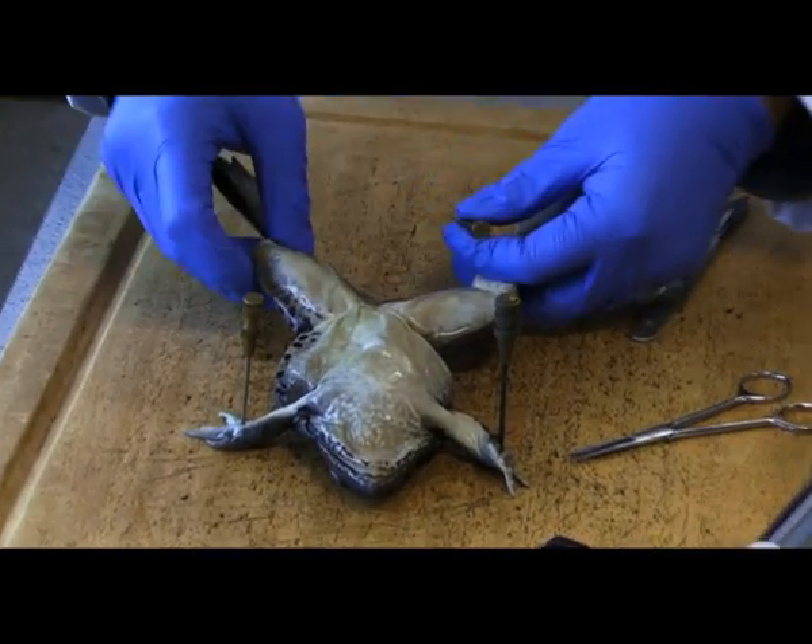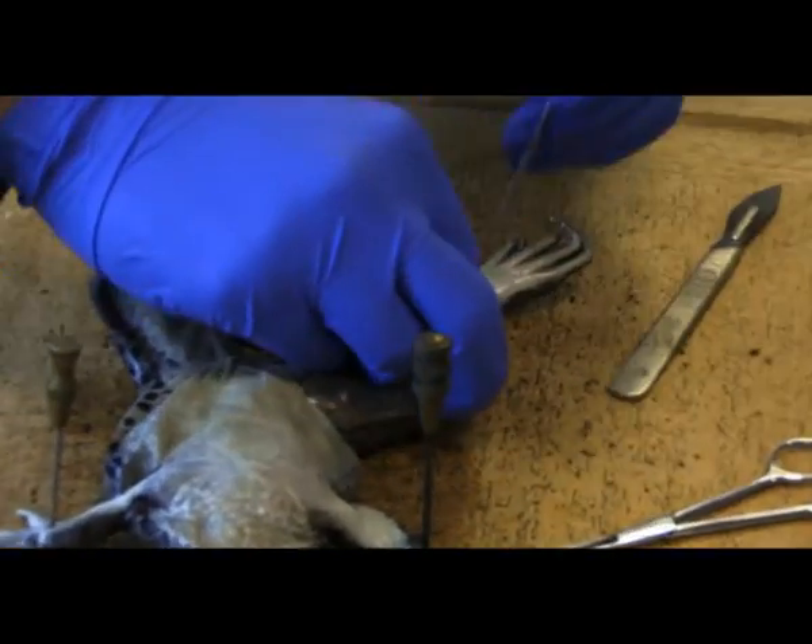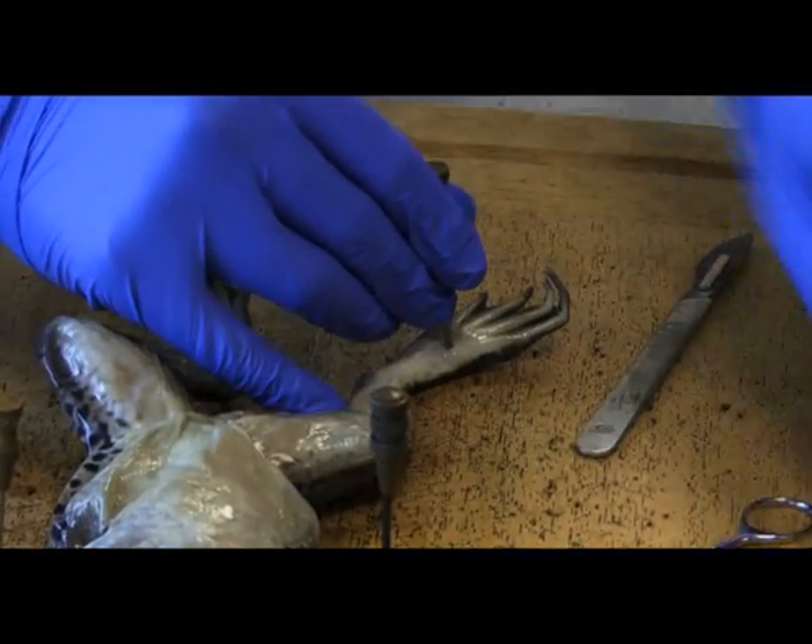You can see here at the bottom as well — I'm just going to open up the legs here and it's straight down the center there.